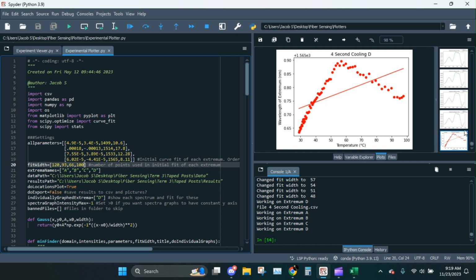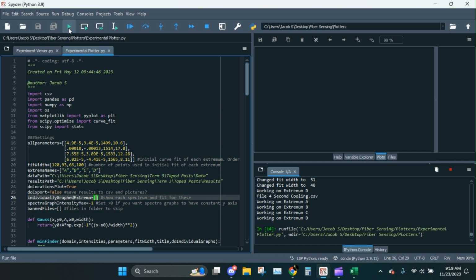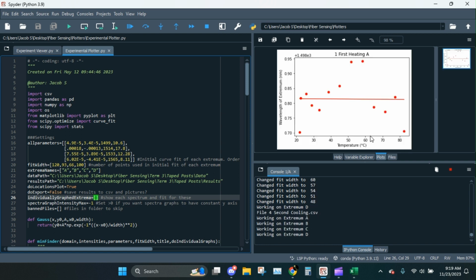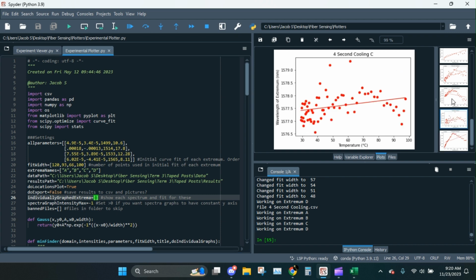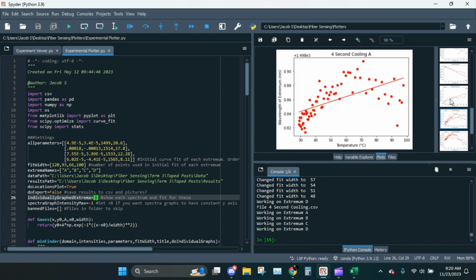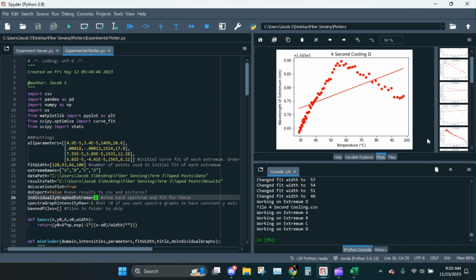We are nearly done. I'm going to close all these. I'm going to tell it to not do the extrema anymore. Run it one more time just so we can see the pictures without being interrupted with all the spectra. Boom. And here we are. All right. So this is everything. Now that there's no errors, we're ready to export.